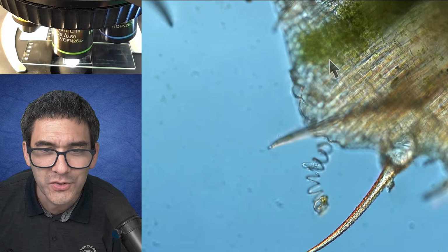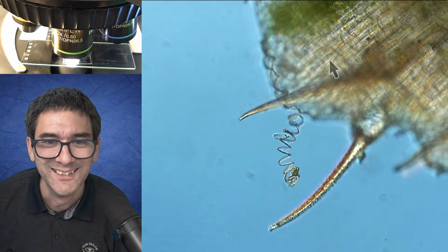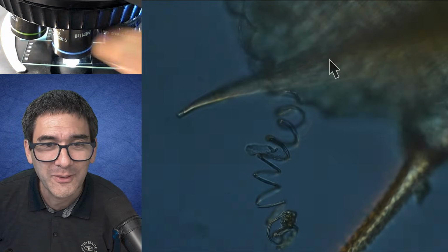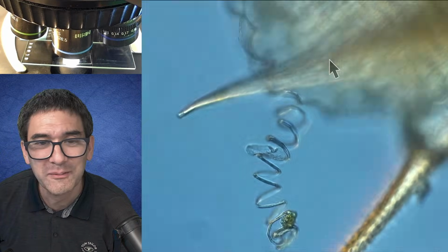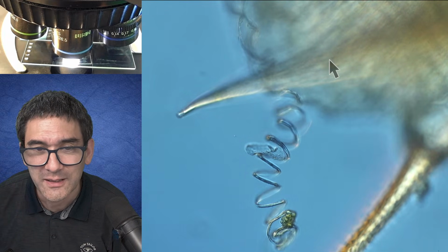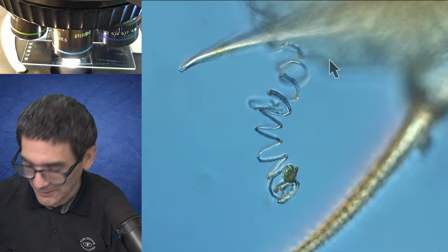Look here, also very nice. I love it. What do I see here? What is this here? Let's open it a little bit. Of course. Monocot or dicot? Yes, a dicot. I will explain why.